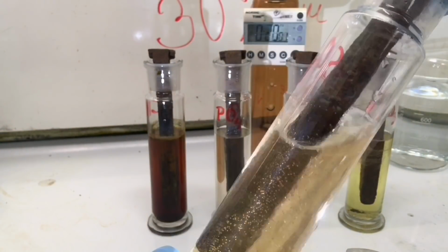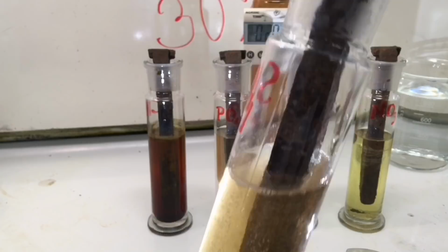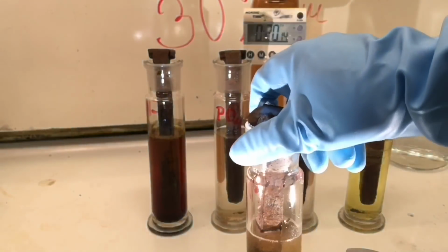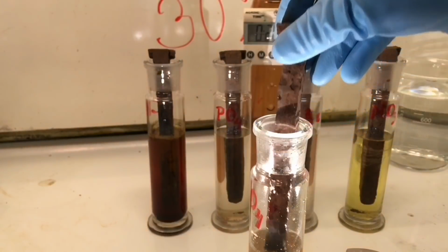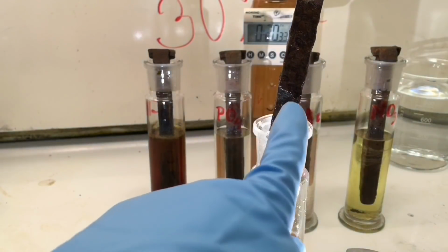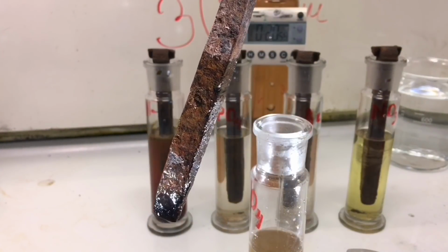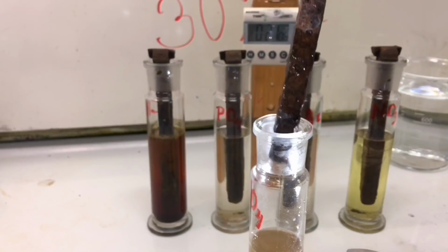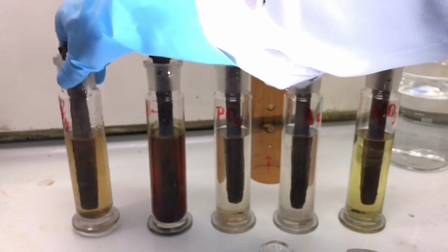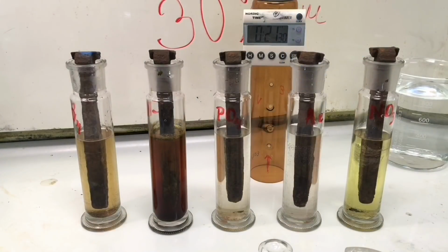And then we will check the sulfuric acid. Here the solution is muddy. I'm going to take it out. Bubbles are forming continuously. And on one little spot right over there I can see iron. Right there. Most of the rust is intact. Or not intact, but still present on the railway nail. So we'll keep going for another 15 minutes.